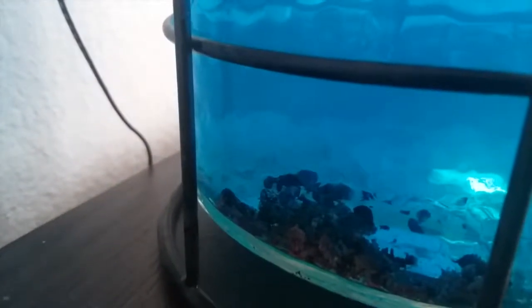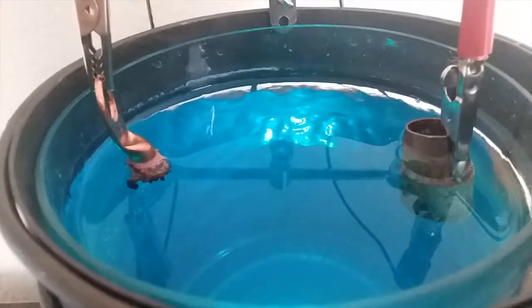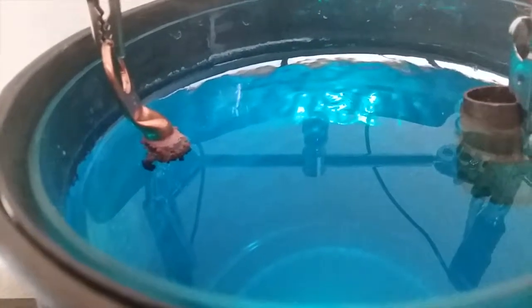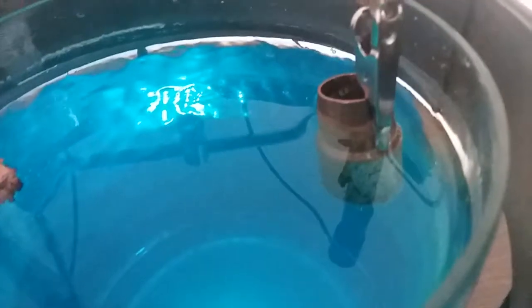In the bottom there's a lot that's just fallen off — built up on the copper up there and gotten too heavy for what was connecting it, then falling off. It may be a consequence of growing it too quickly maybe. But I'll keep growing quick. Some of it I think will be on there well enough to not fall off. Can't tell any obvious loss of mass on that side.